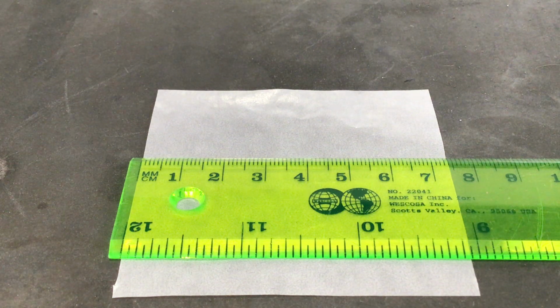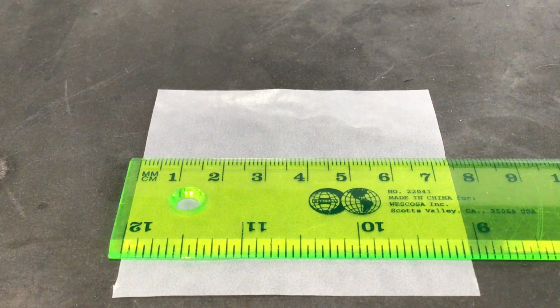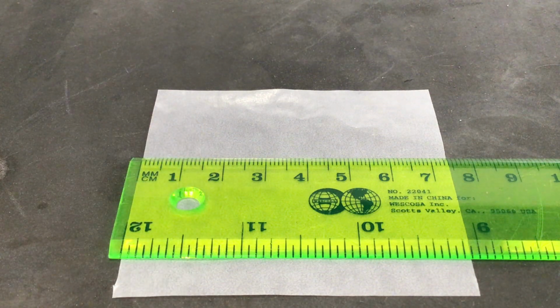And the one thing to really point out about significant figures when making measurements where you have calibrated markings like this is that the last decimal place you would report should always be one decimal place further than whatever the tick marks are themselves. So if I was giving this measurement in centimeters, all of those little tiny tick marks that are here are every 1/10 of a centimeter, so like 0.1, which means if I was to report this measurement, I would actually want to give it to 2 decimal places in centimeters.